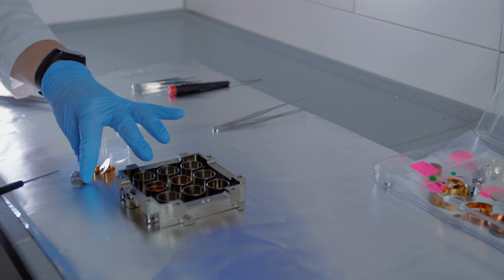The smaller spot size allows us to closely analyze isotopic changes in small crystallites with the size of 1 micron or less. Geological samples were formed during a long period, and the small size allows us to interpret the way the crystallites were formed and which elements were dominantly present in what time frame.